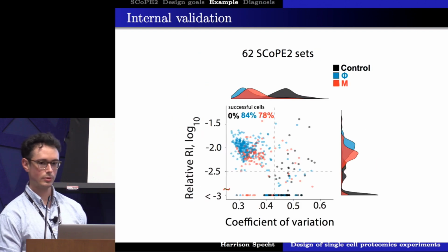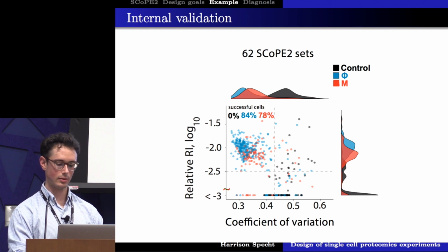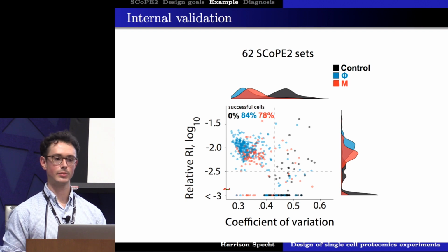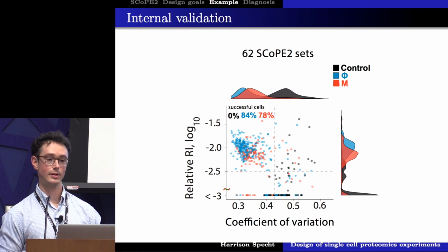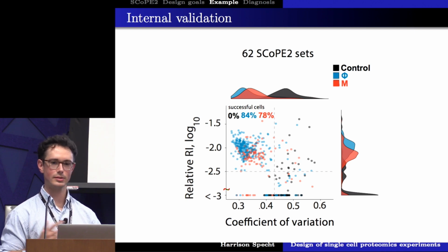Cool. So now we're going to look at the two slides that we just previously saw. We're going to look at the median relative reporter ion intensity for each of those single cells. And then we're also going to look on the x-axis at the coefficient of variation, which I just talked about. And what we can see is that these control wells actually allow us to start to define some heuristic values from which we can use to separate out our poorly prepared single-cell wells and our successfully prepared single-cell wells. We can see that consistently, these control wells have much higher coefficient of variation, meaning the peptide signal that we got from them doesn't agree with one another for the proteins that they should have belonged to.